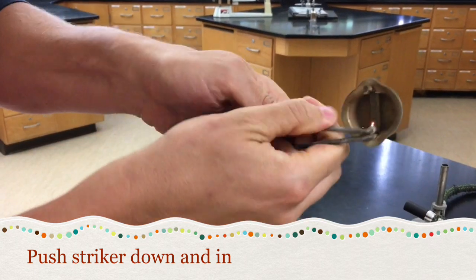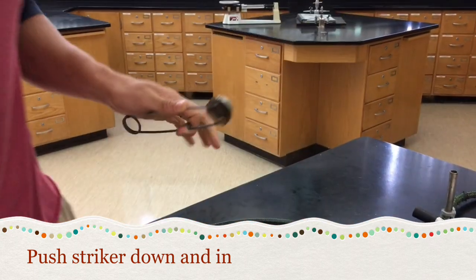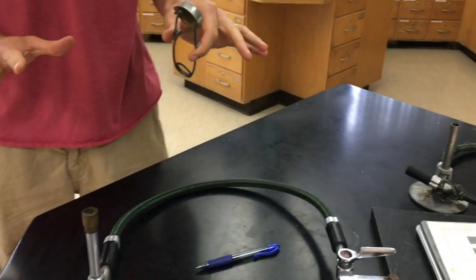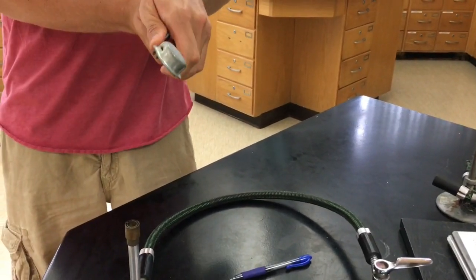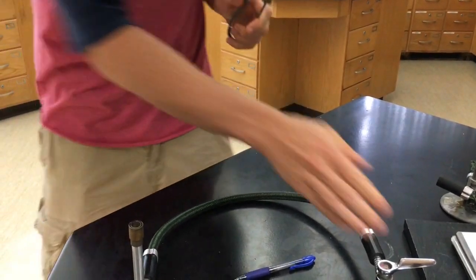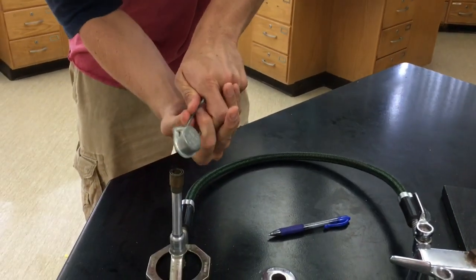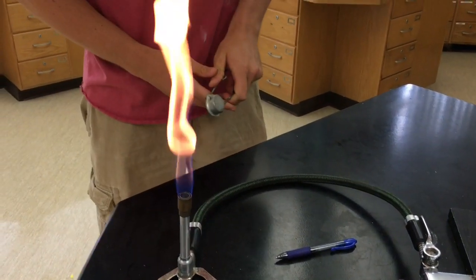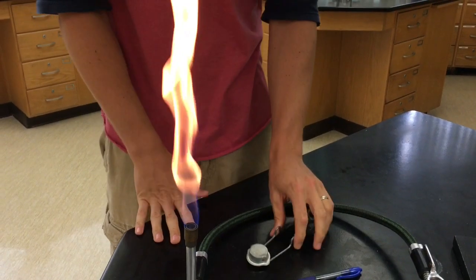The trick is to push down and across to create a lot of sparks. A lot of students are really shy with the striker — they'll try to light the flame from way up high. The best way to do it is to go right in for it, stick it right over the barrel, and light the flame.